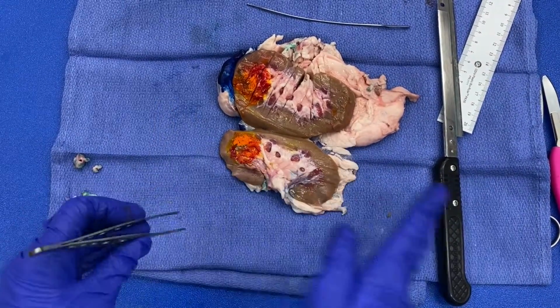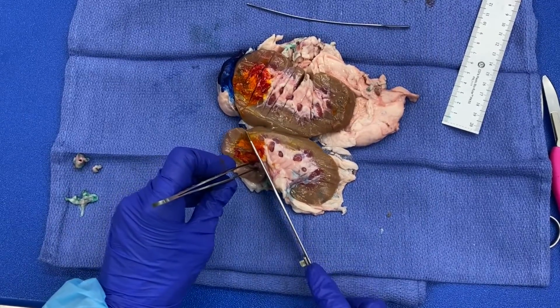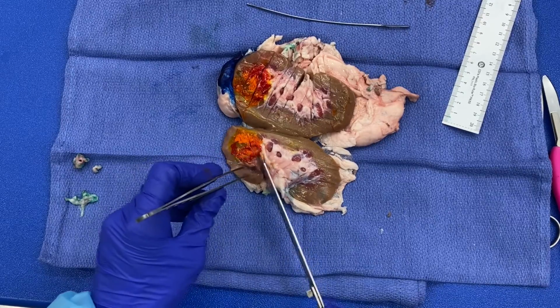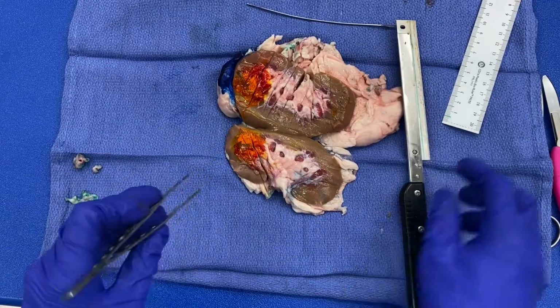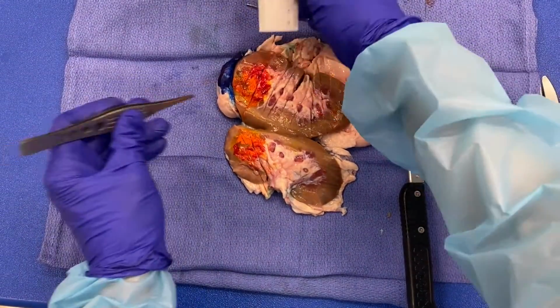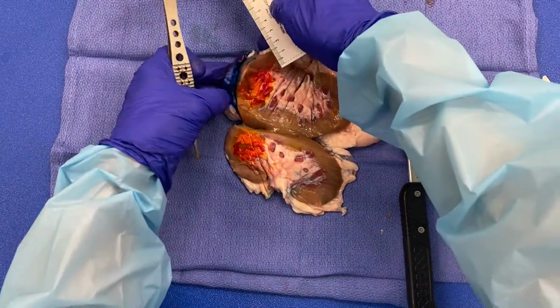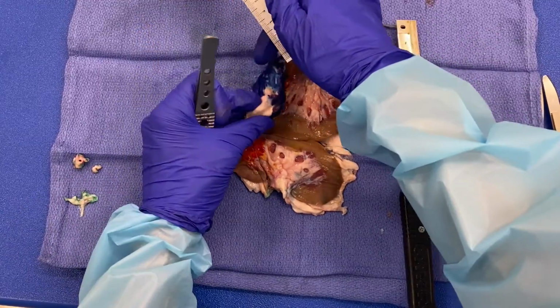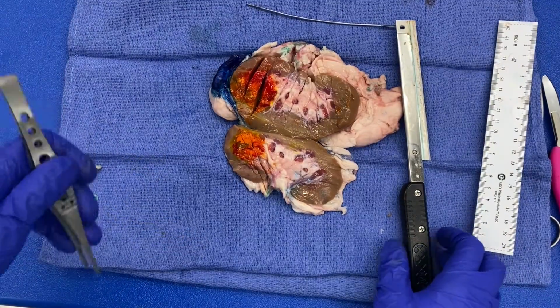Okay, so then you are going to serially section the specimen prior to allowing it to fix. In this particular case, I'm going to make a cut here so that I can take a section of tumor in relationship to my renal pelvis and to my renal sinus fat. Another measurement you want to take after sectioning is the distance to the capsule. Well, in this particular case, you can see this orange ink up here, so it's abutting the capsule. And then you want to measure the distance to that Gerota's fascia, which is that blue inked margin. And so you can do that after sectioning.